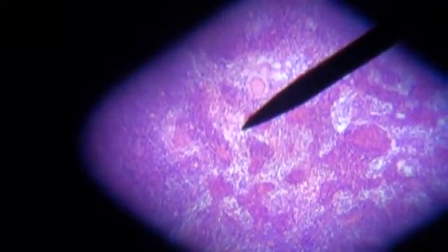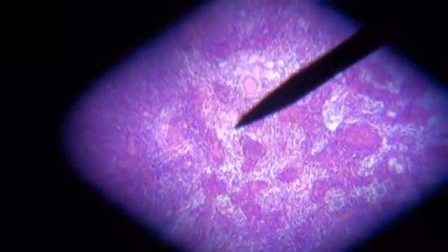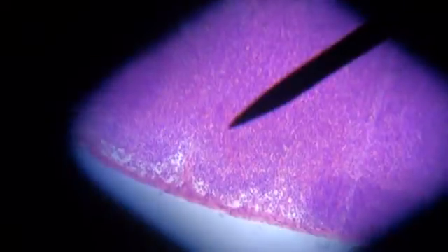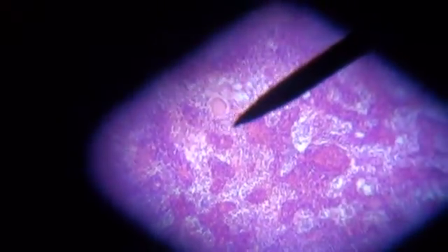So I've just shown you the lymph node and identified the germinal center. I'll show you once again: germinal center, cortex, and medulla.